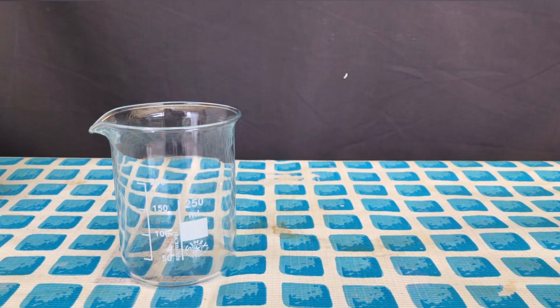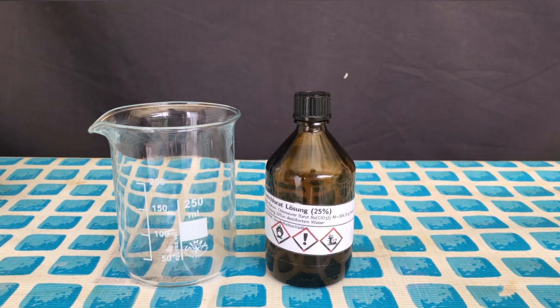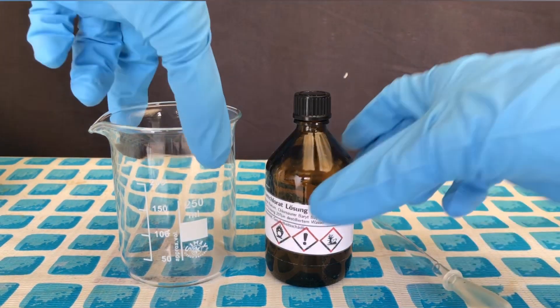Welcome back everyone. Today we are going to be making some chloric acid. I didn't plan to film this in the first place, but I did, so here you go.